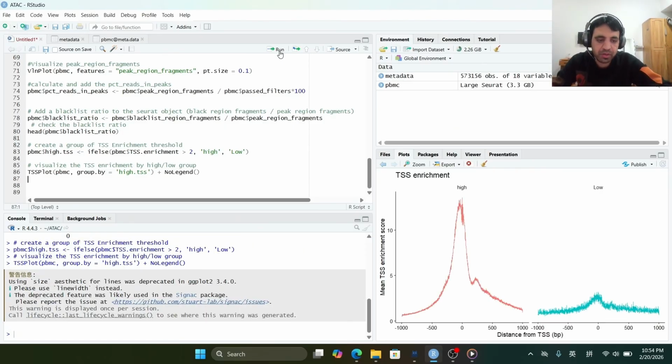The plot has been generated, and there are two curves. The x-axis shows the distance from the TSS, and the y-axis shows the TSS enrichment score. The high curve shows the high quality cells with strong promoter accessibility and open chromatin regions, and similarly the low curve shows low quality cells or empty droplets with closed chromatin or weak promoter accessibility.